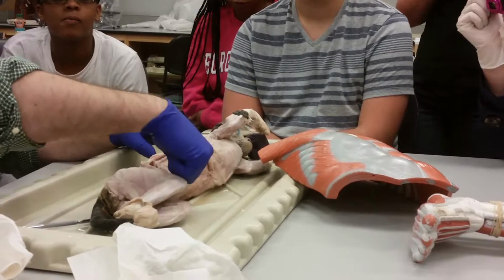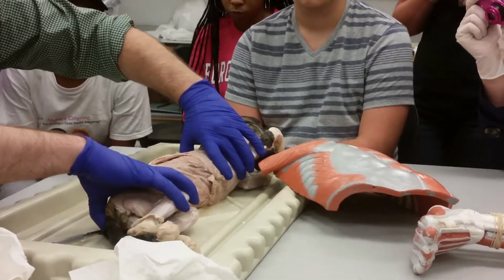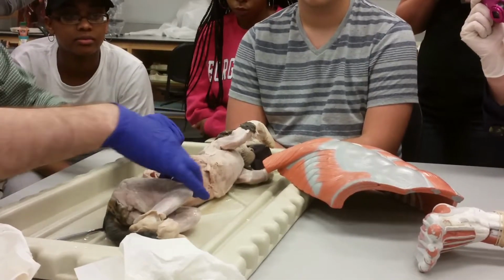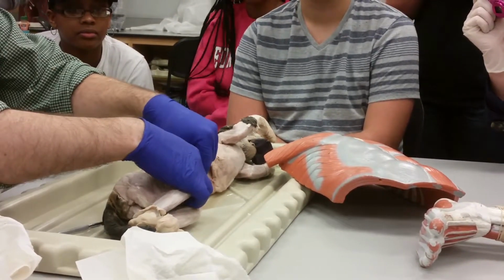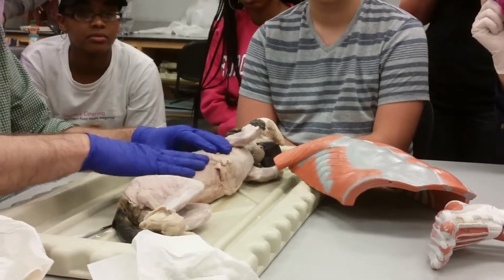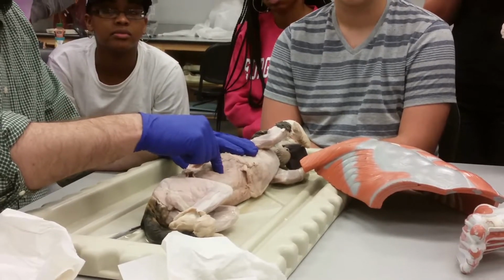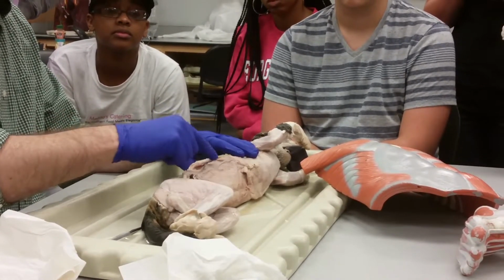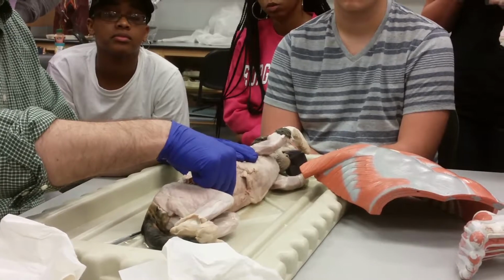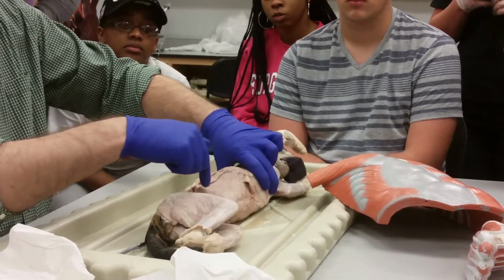It's pulling from lateral to medial. So in addition to flexing the torso, it's going to rotate the torso; you can think of it trying to pull the lateral around towards the medial. So it's going to rotate it like that. This is the external oblique. It flexes the torso, it compresses the abdomen, and it rotates the torso towards the opposite side from the muscle. It rotates it that way if it's this muscle, and the other way if it's that muscle.